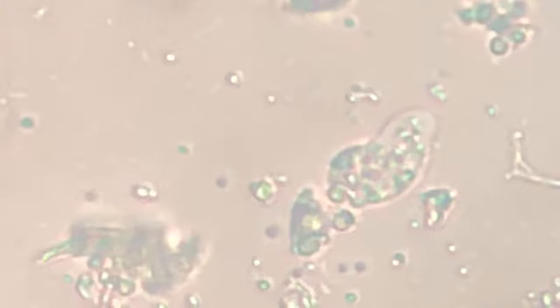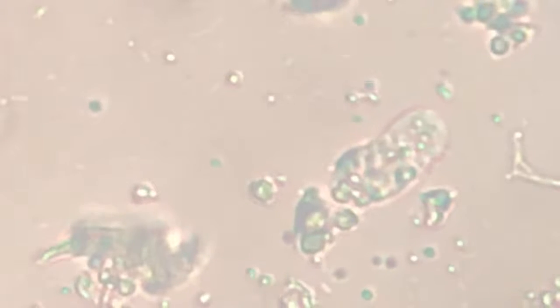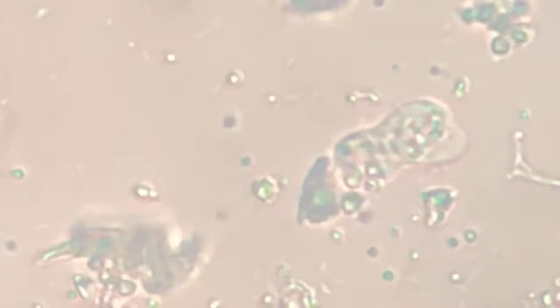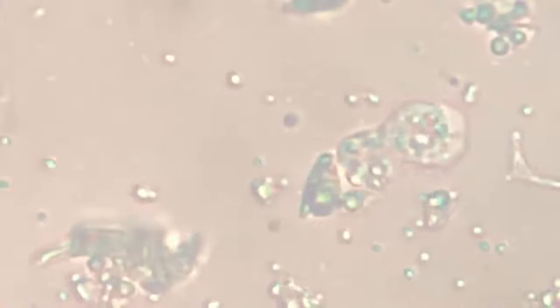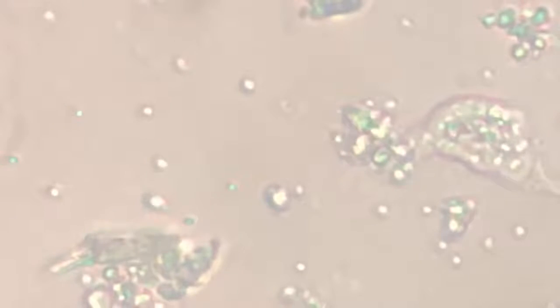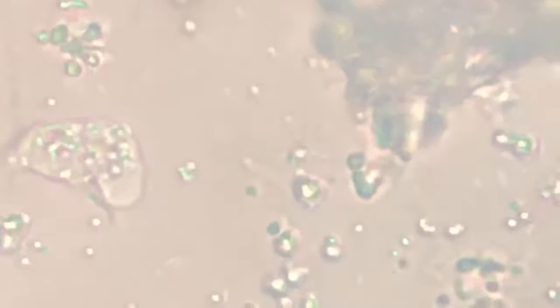Ectoplasm, the pseudopodia, a beautiful way. I'm just wondering about the early days of microscopy, when the technology was not this advanced and the biologists or naturalists had very simple basic microscopes, not these high-end lenses that we have these days. The light systems were different.